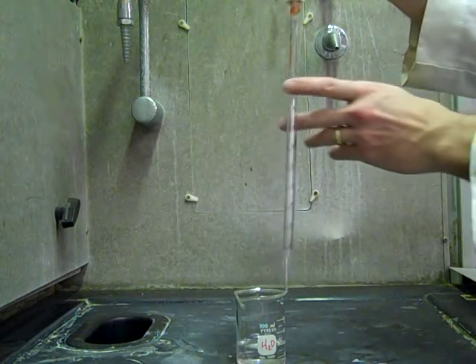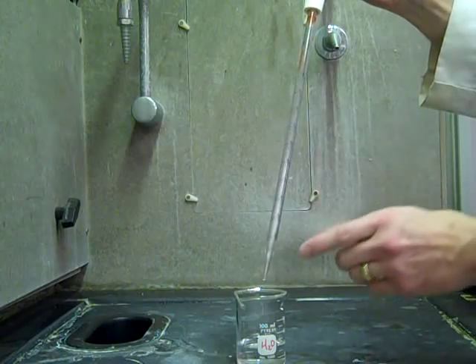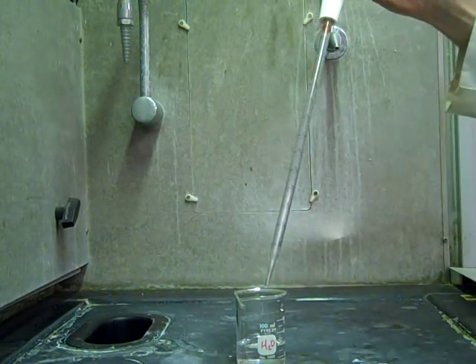There should be a little bit like a little reservoir left in the tip. You leave it there because it's calibrated to allow for that little amount that's at the tip.